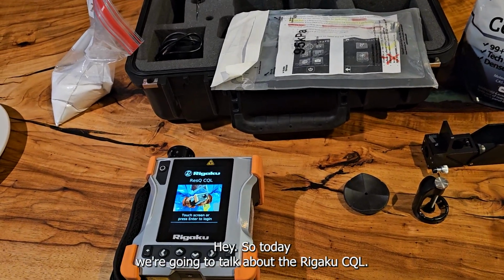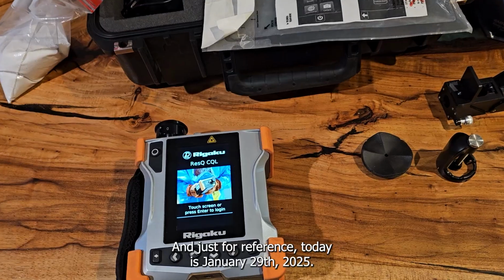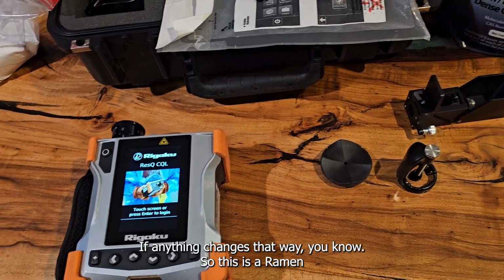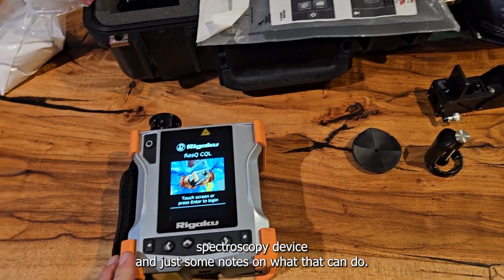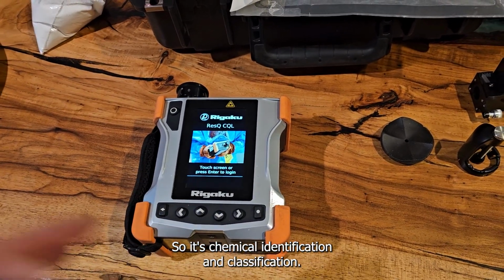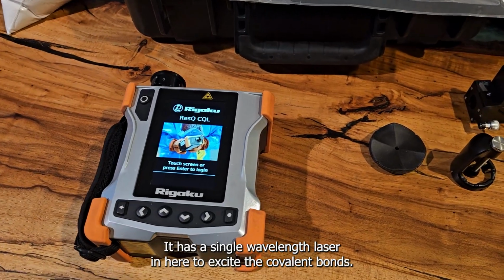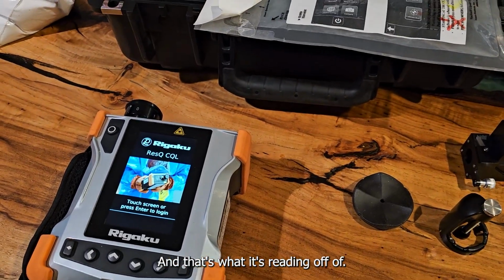Okay, so today we're going to talk about the Rigaku CQL, and just for reference, today is January 29th, 2025. If anything changes, that way you know. So this is a Raman spectroscopy device, and just some notes on what that can do. It's chemical identification and classification. It has a single wavelength laser in here to excite the covalent bonds, and that's what it's reading off of.